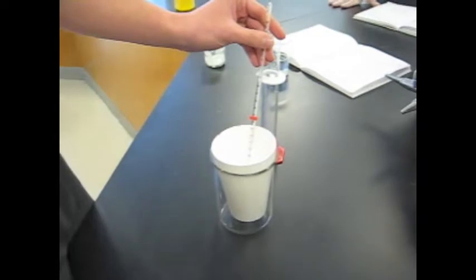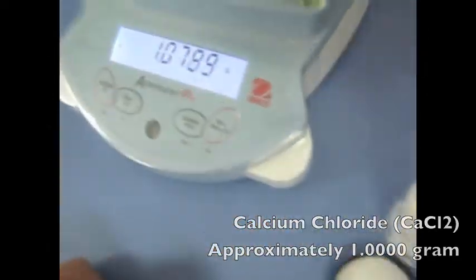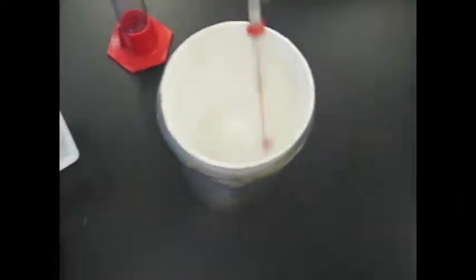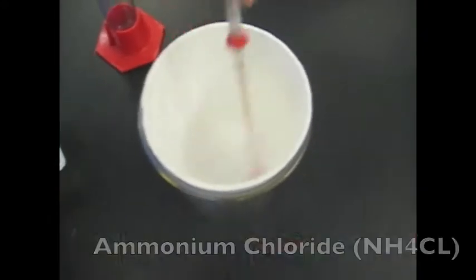Record the initial temperature. Then, using a weigh boat and an analytical balance, measure approximately 1 gram of calcium chloride. Add the 1 gram of calcium chloride to the water in the styrofoam cup and record the final temperature. Repeat this process again using new materials and ammonium chloride.